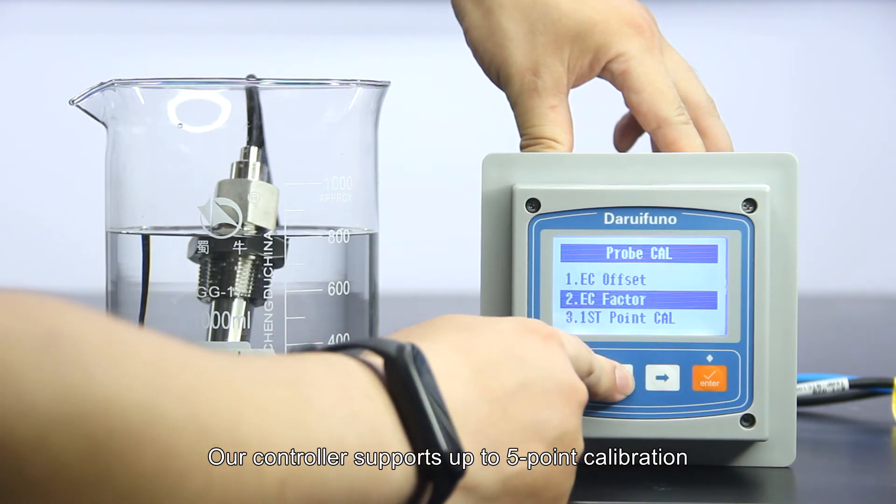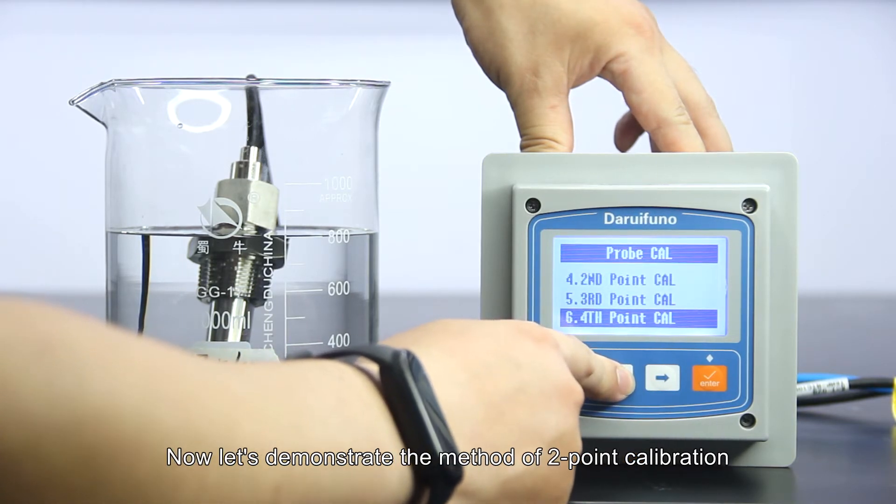Our controller supports up to 5 point calibration. Now let's demonstrate the method of 2 point calibration.